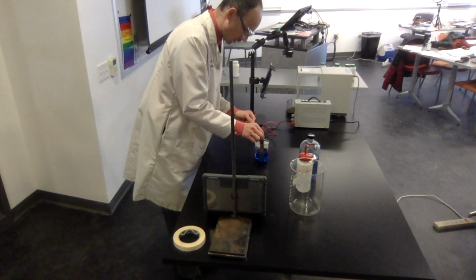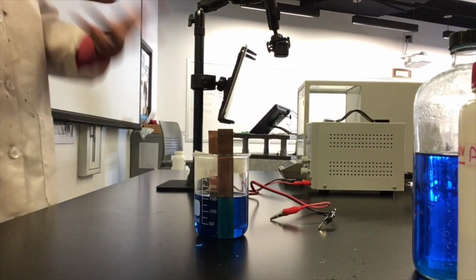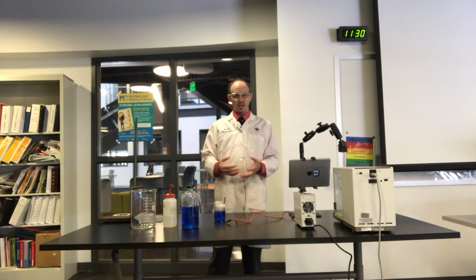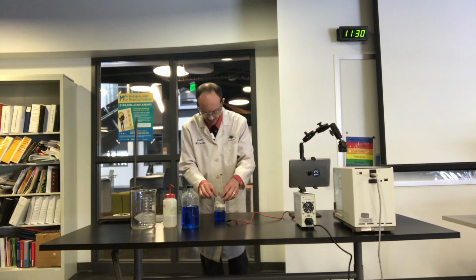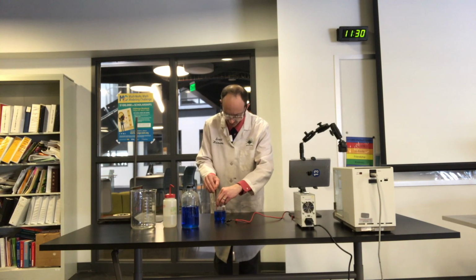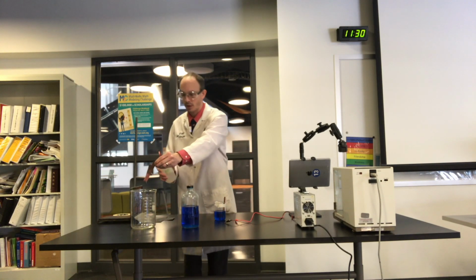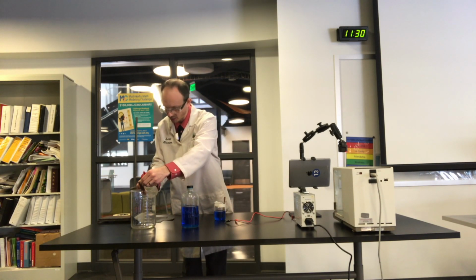All I'm going to do is disconnect it. We're going to rinse the cathode and anode, and then we're going to take the final mass. But while I'm doing that, what I would recommend is finding the average amperage for that whole time. It's going to be a little bit tricky, but I believe in your mathematical abilities.